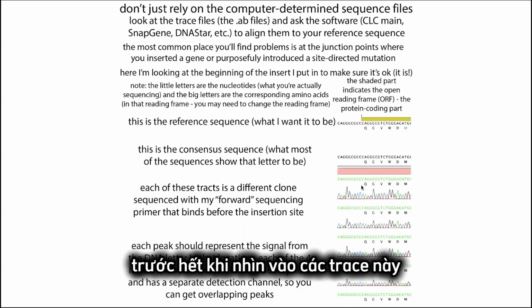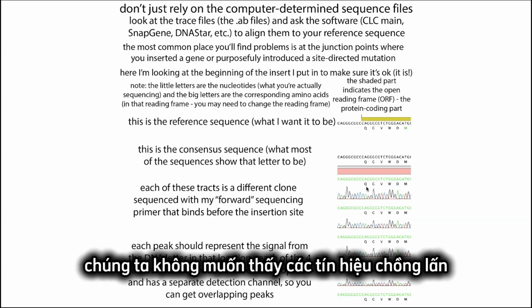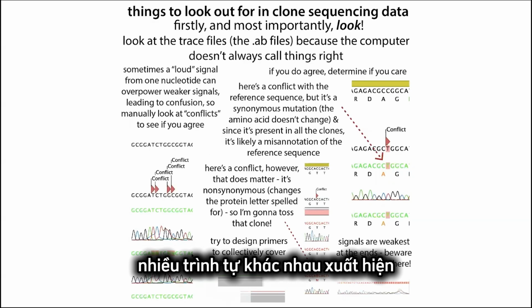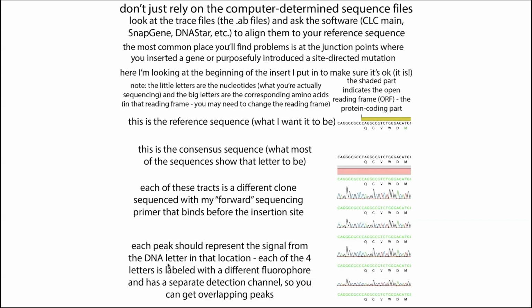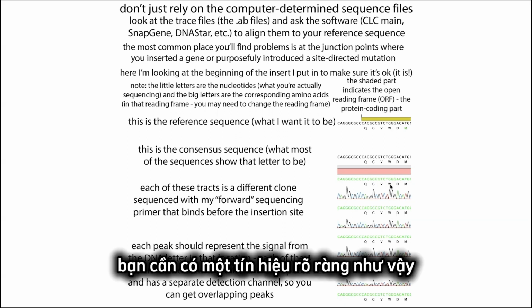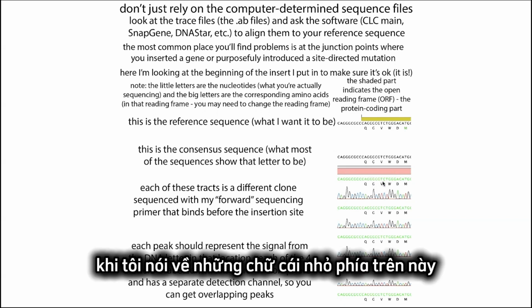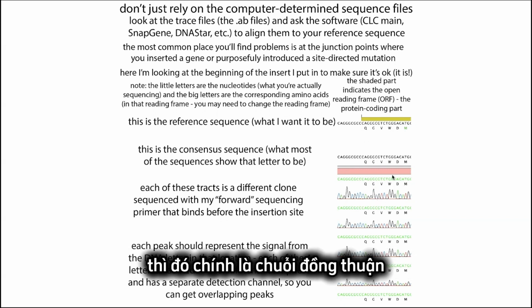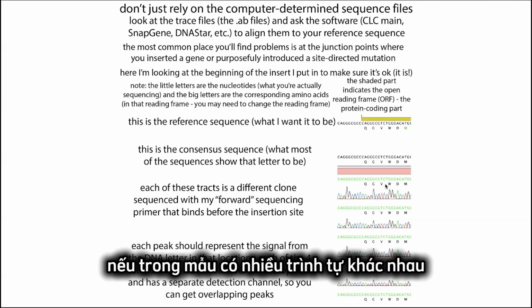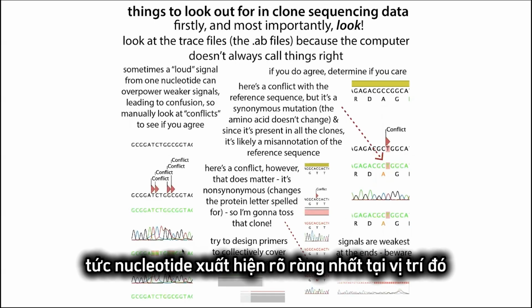So first of all, when we look at these traces, we want to see a nice clean trace like this. We don't want to see overlapping traces, which would indicate that we have multiple sequences present, some sort of contamination, or multiple plasmids in there, which wouldn't be good. Basically, what you should have is this nice clean signal, and if you do, you should get a consensus sequence. So when I was talking about these little letters up here telling you which DNA letter was read out, this is the consensus sequence. If you had multiple sequences in here, this is going to be the most prominent nucleotide at that position.